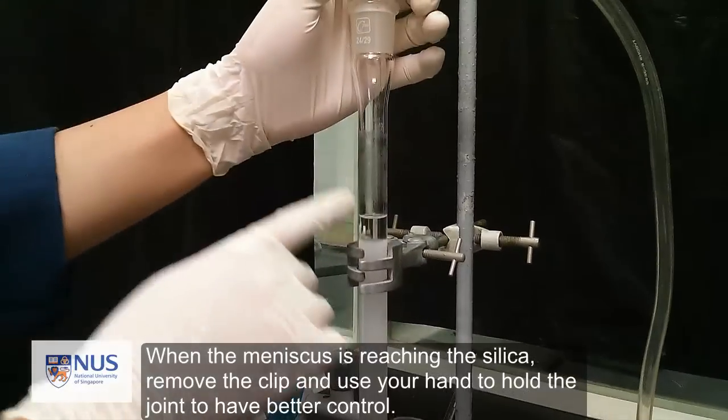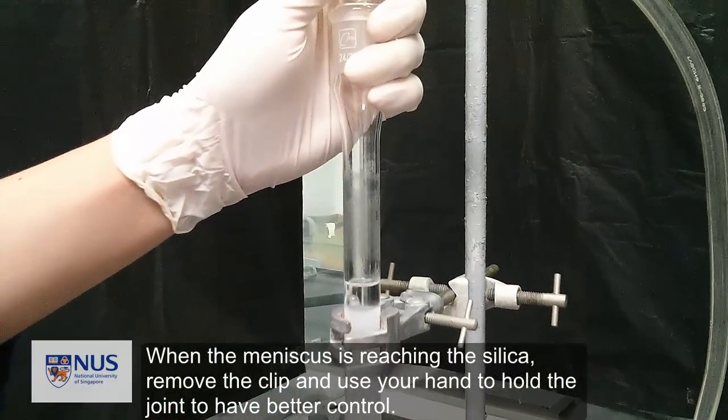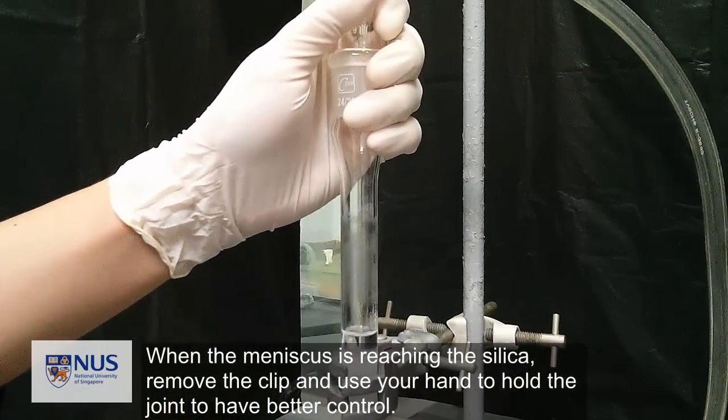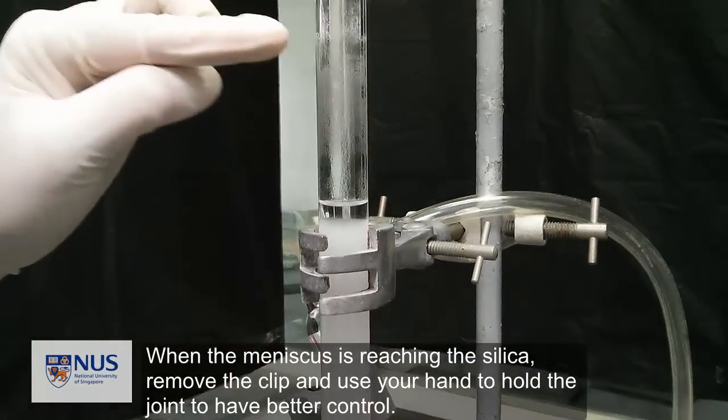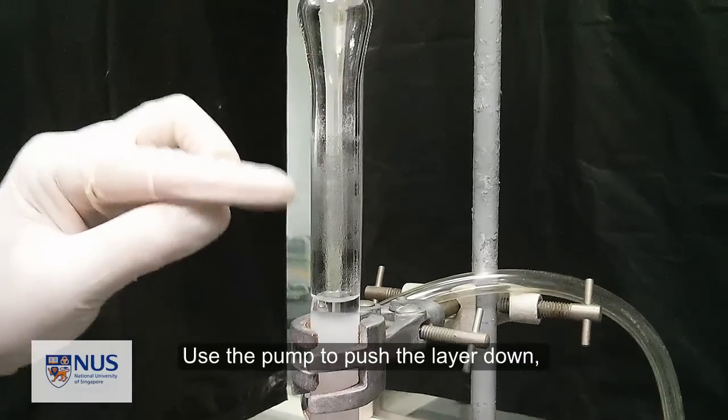When the meniscus is reaching the silica, remove the clip and use your hand to hold the joints to have better control. Use the pump to push the layer down.